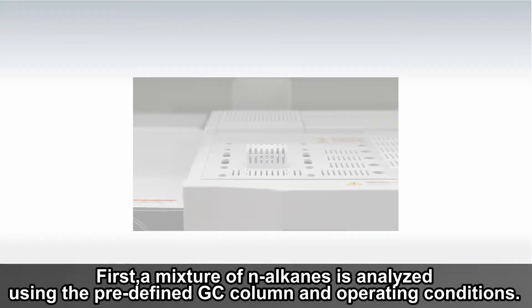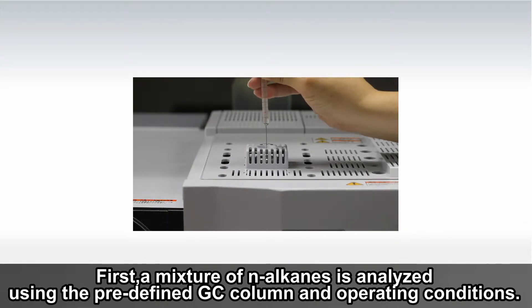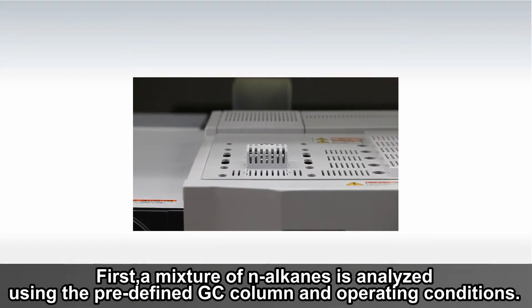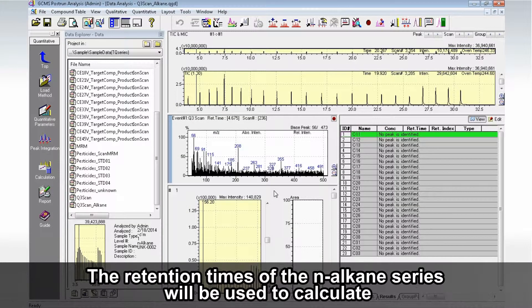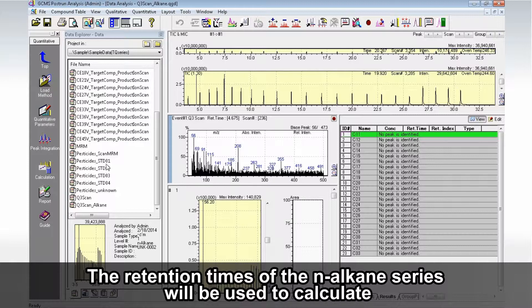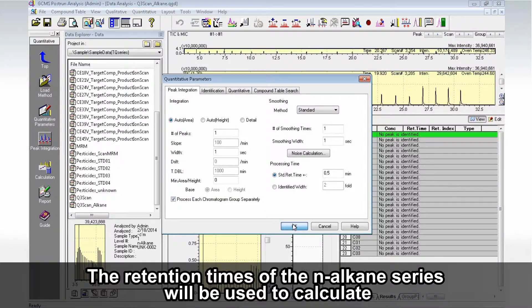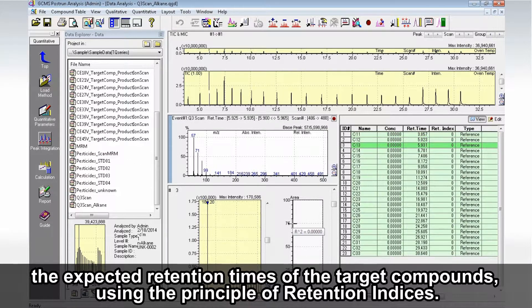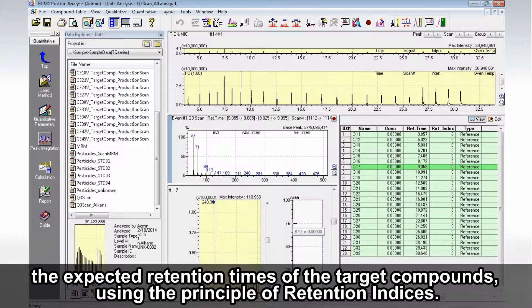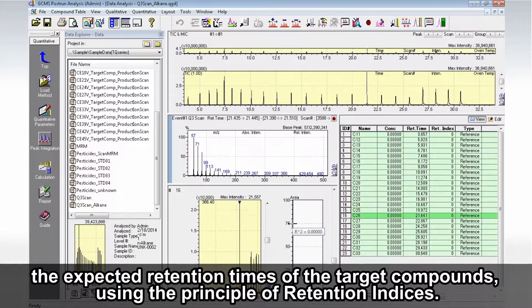First, a mixture of N-alkanes is analyzed using the predefined GC column and operating conditions. The retention times of the N-alkane series will be used to calculate the expected retention times of the target compounds using the Principle of Retention Indices.